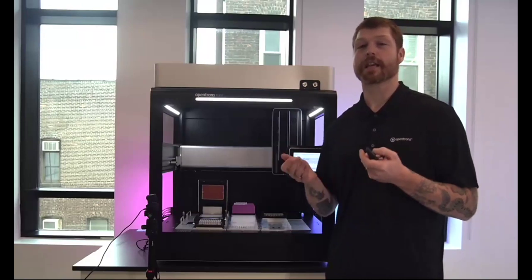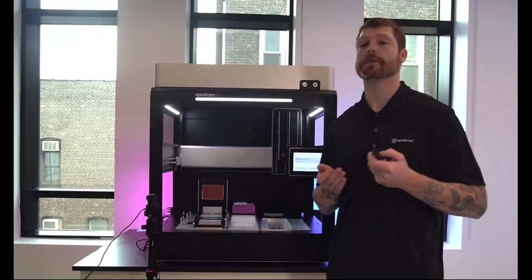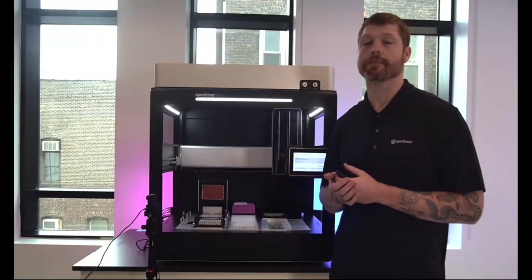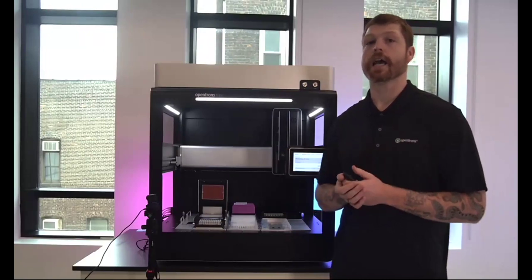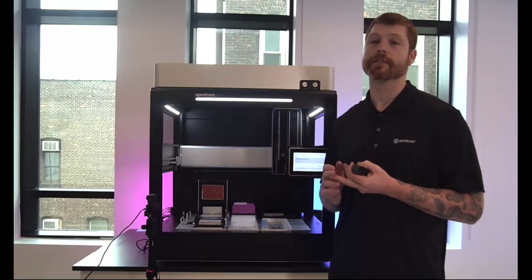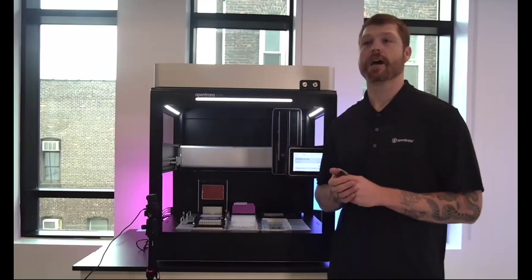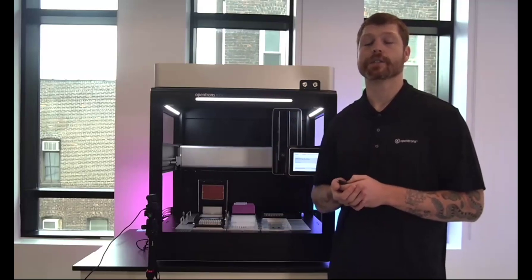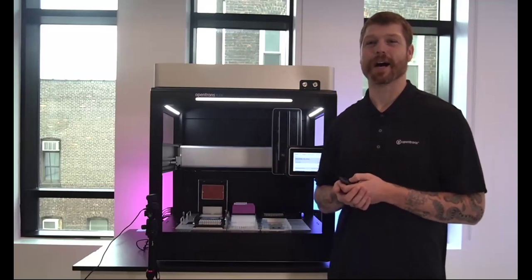And because of this pause behavior now, you'll have the ability to actually follow some guided workflows straight through the touch screen on the robot to allow you to correct for this error and hopefully resume your protocol. You also have the option to get rid of tips or skip the step and perform it manually. So there's really a lot of options now, which will allow you to continue with the run of your protocols here. So a huge improvement, really going to hopefully affect everybody who is using the robot in a very positive way.